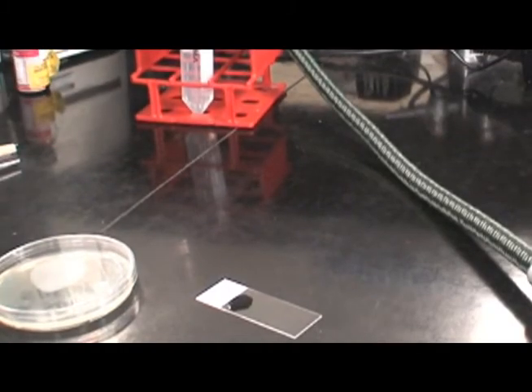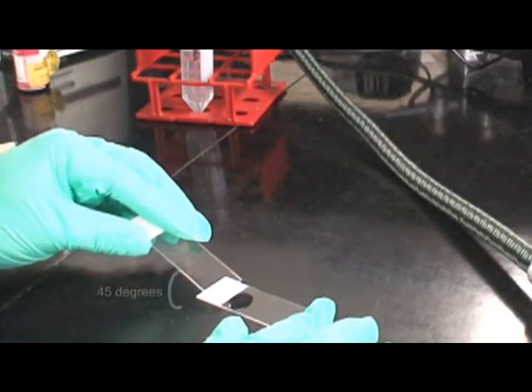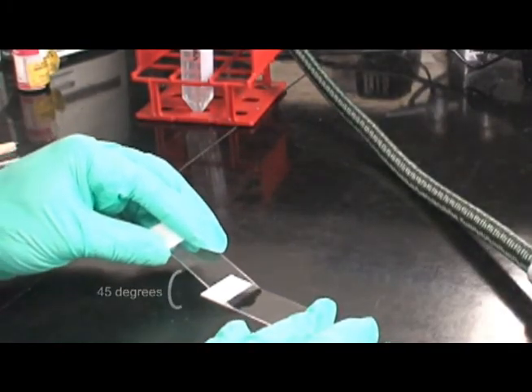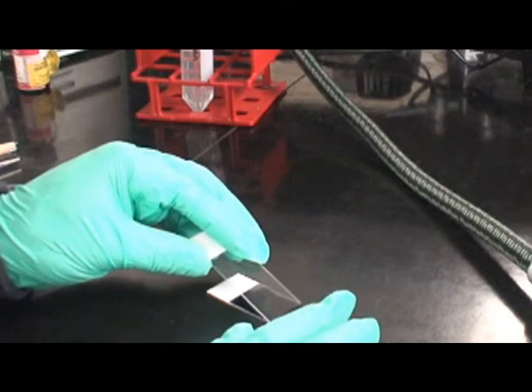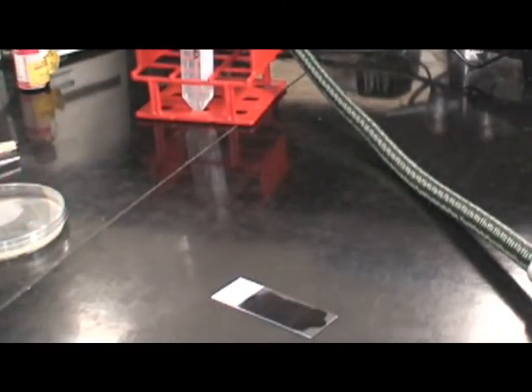Using a second sterile microscope slide at a 45 degree angle, gently spread the drop containing the bacteria across the slide, creating a thin film as shown here.